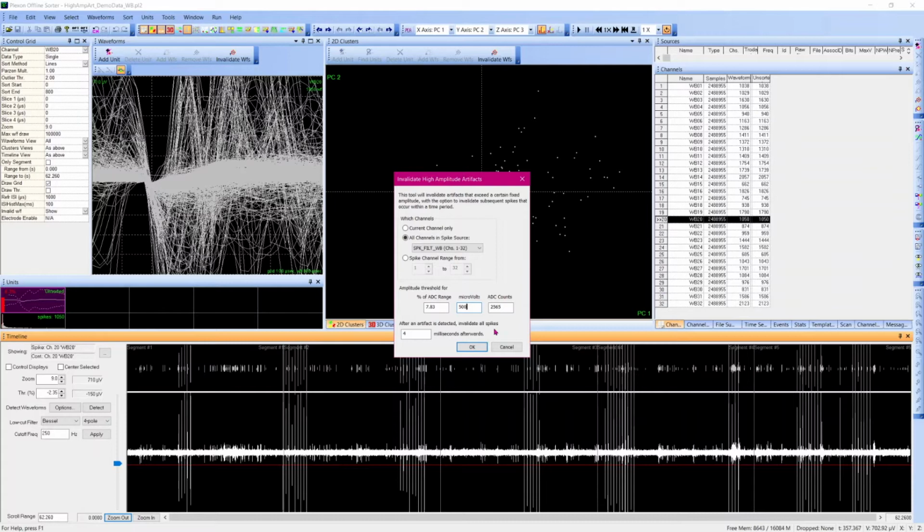From looking at these data, the artifact creates 3 to 6 waveforms. Each waveform is 800 microseconds because that is what I defined them to be when I detected. For these data, I did not see any true waveforms occurring closely around the artifacts. To make sure I get the entire artifact, I'm going to say that up to 5 waveforms that immediately follow the artifact are also artifacts, even if they don't cross the amplitude level. That means for the time setting, 4000 microseconds, or 4 milliseconds, which is 5 waveforms of 800 microsecond length. It is possible I may invalidate true waveforms with such a long time setting, but in these data, I'm more concerned with invalidating the whole artifact and am willing to lose a few true waveforms. If your data has activity that is near an artifact, it will be more beneficial to have a conservative time setting.